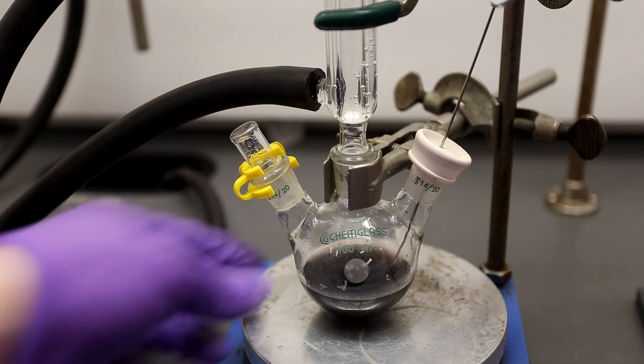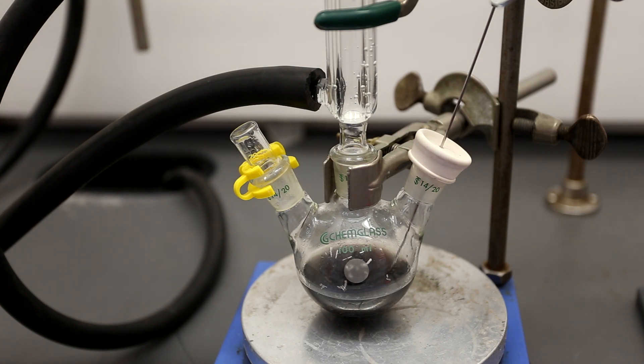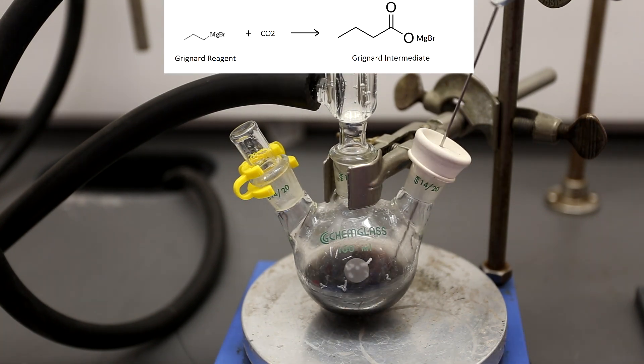As more and more CO2 is added, the solution becomes thicker and thicker. The reaction between the CO2 and the Grignard reagent is shown above.